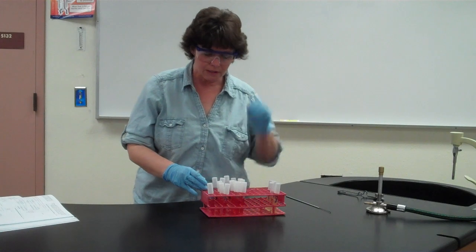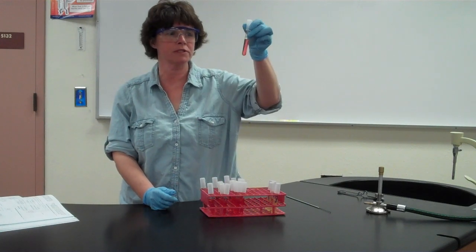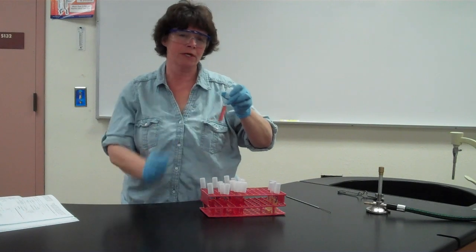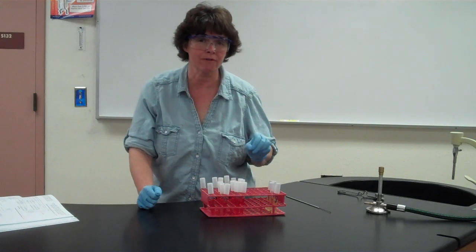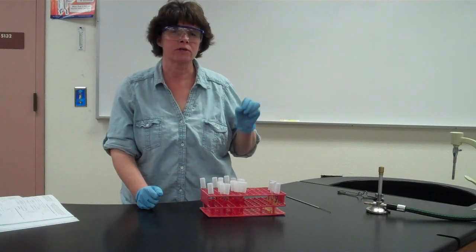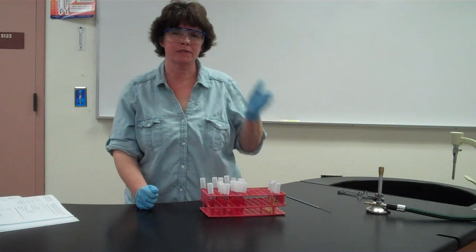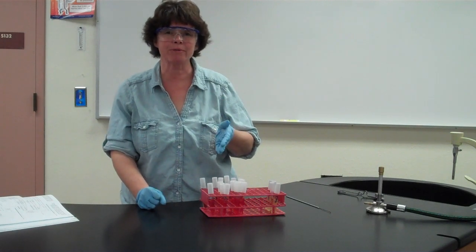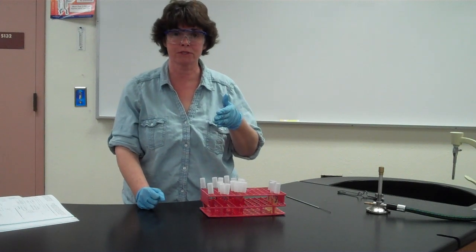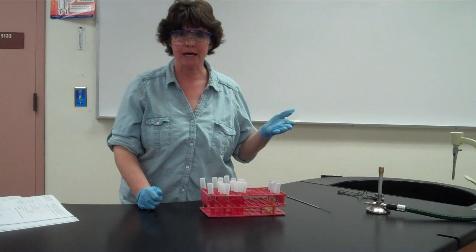So the other thing is, before you actually inoculate them, make sure you observe every single tube. Notice if there's an air bubble in the Durham tube already, because if there is, you're going to have to account for that at the beginning. So if you notice an air bubble, kind of estimate the size of it. So the next time, if there is a bubble, a gas bubble, and if it's bigger, then you can determine gas. But if it remains the exact same size, then it's not really gas production.